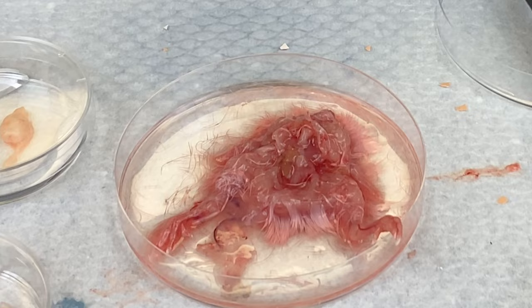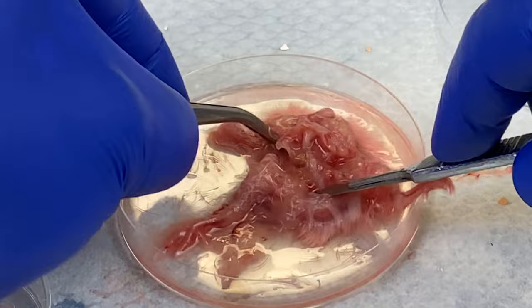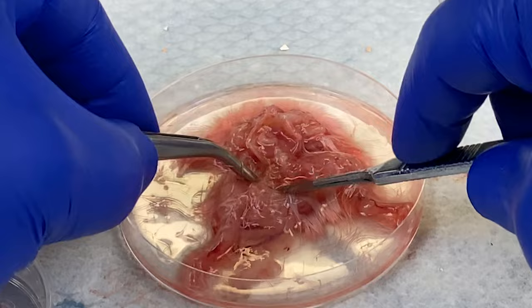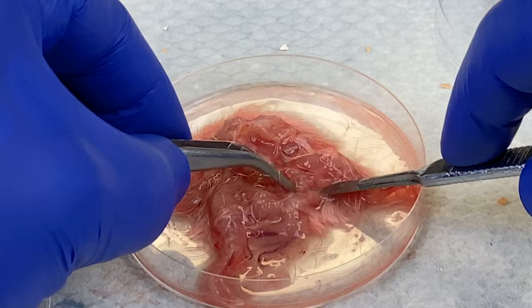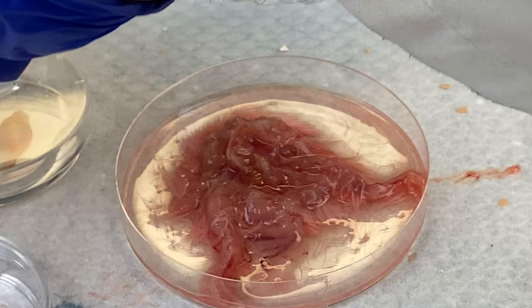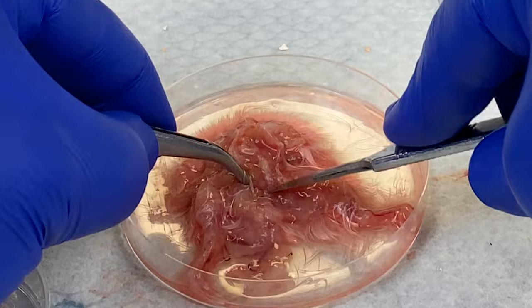I will go after the kidney. The kidney is actually very difficult to obtain — it's right in the back. It's easy to spot though: it's very small but very, very red, full of blood vessels. You can see there's a bit of liver left behind there. Searching for the kidney — I see it right there. Let's pull it out. See how red it is? Very red and quite small. There should be two, but I only found one in this embryo — perhaps I was not looking hard enough.